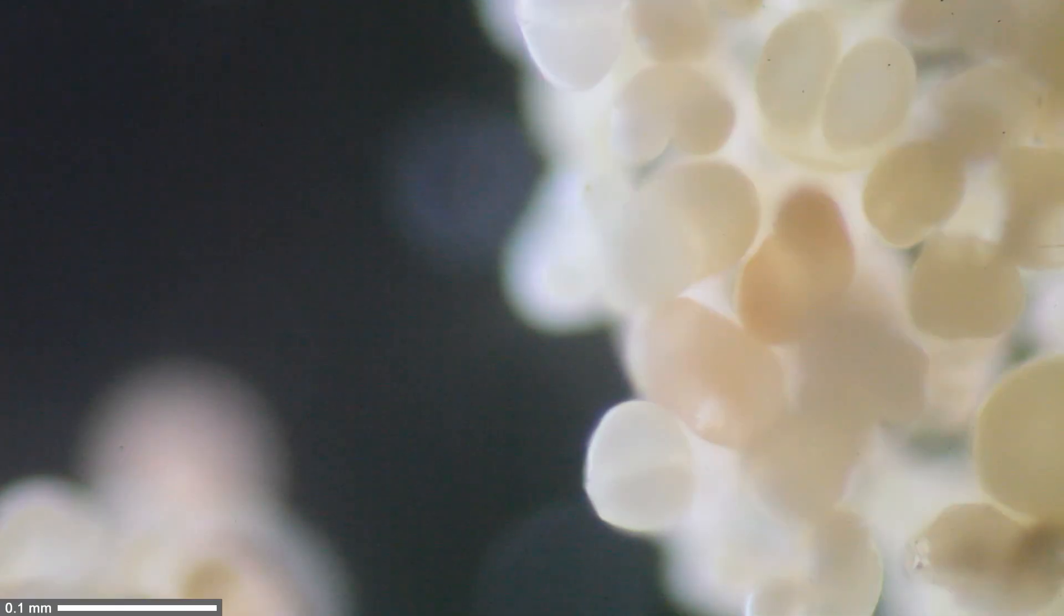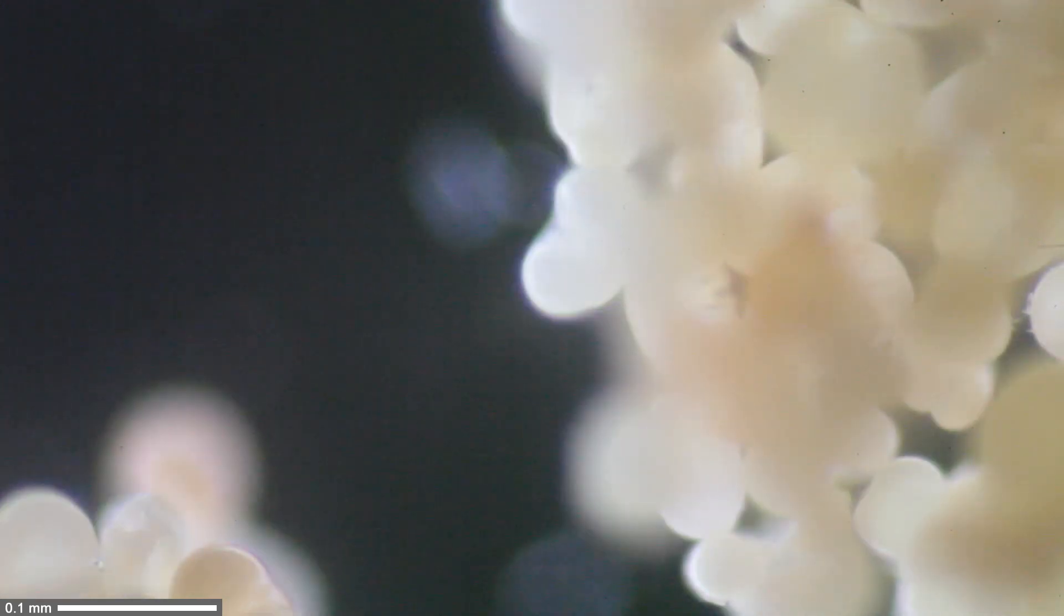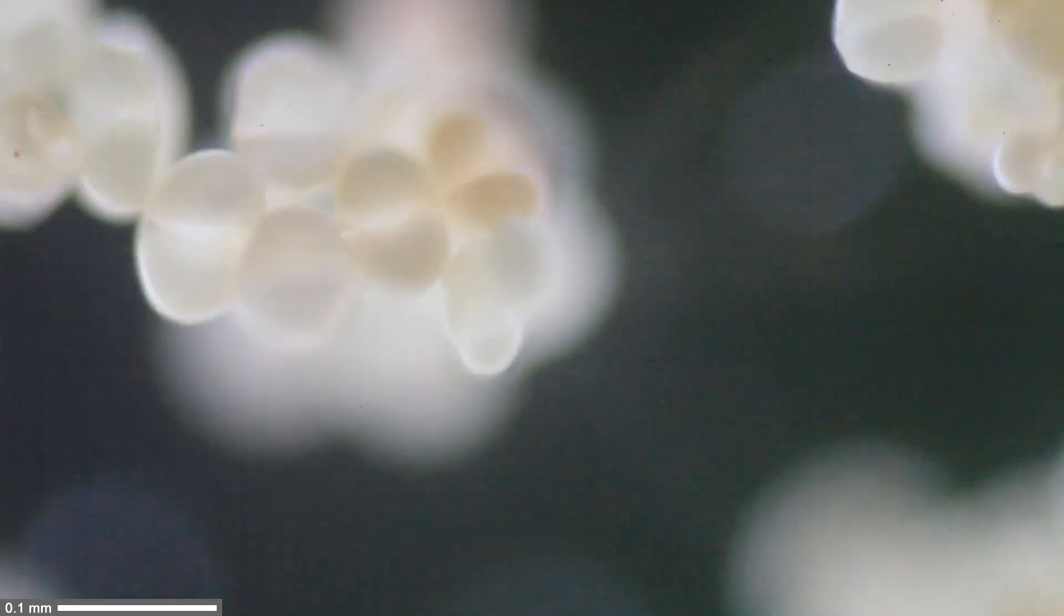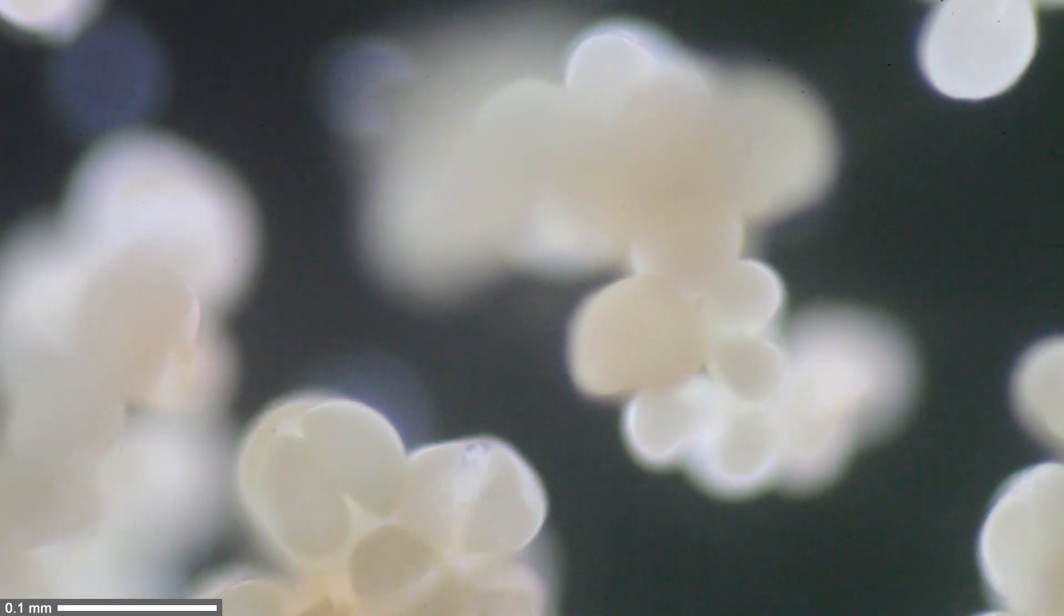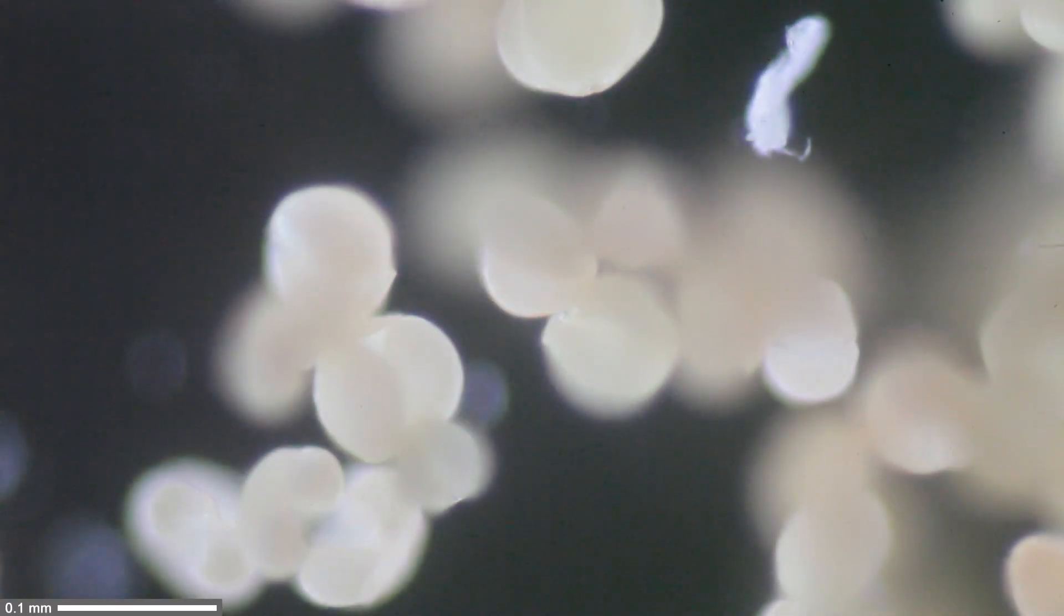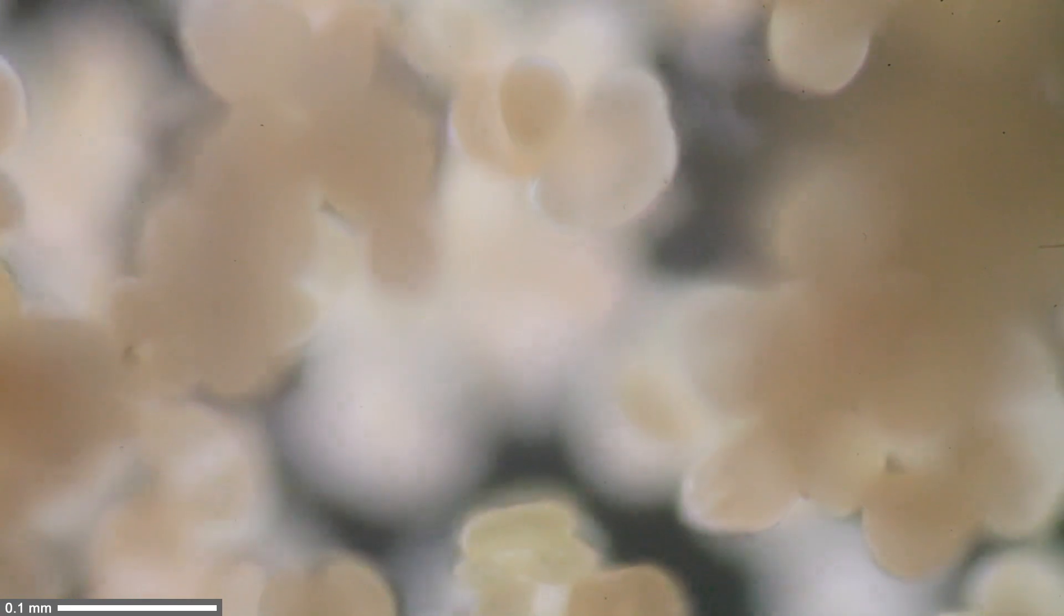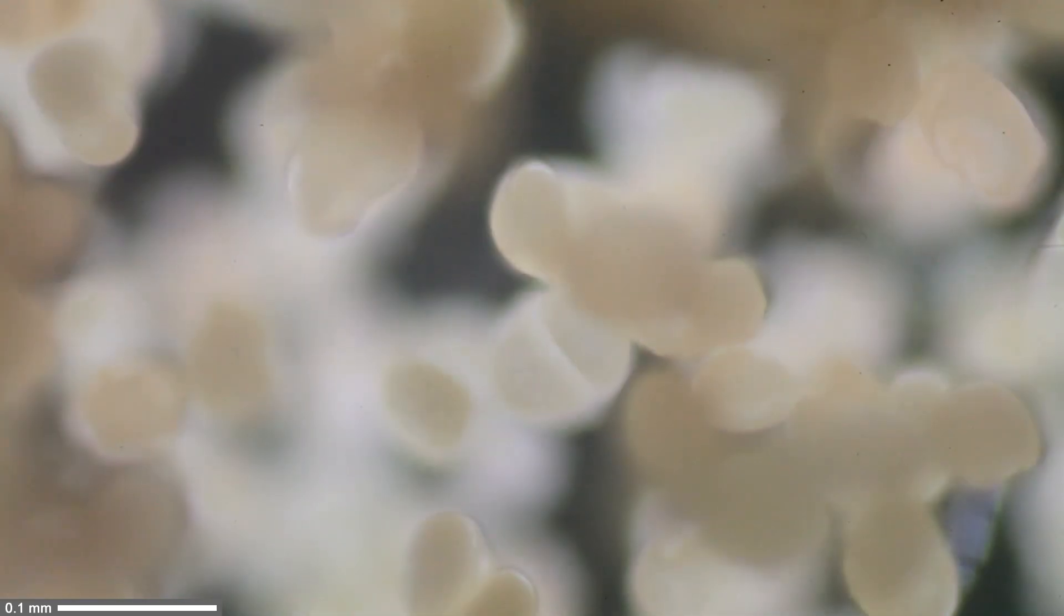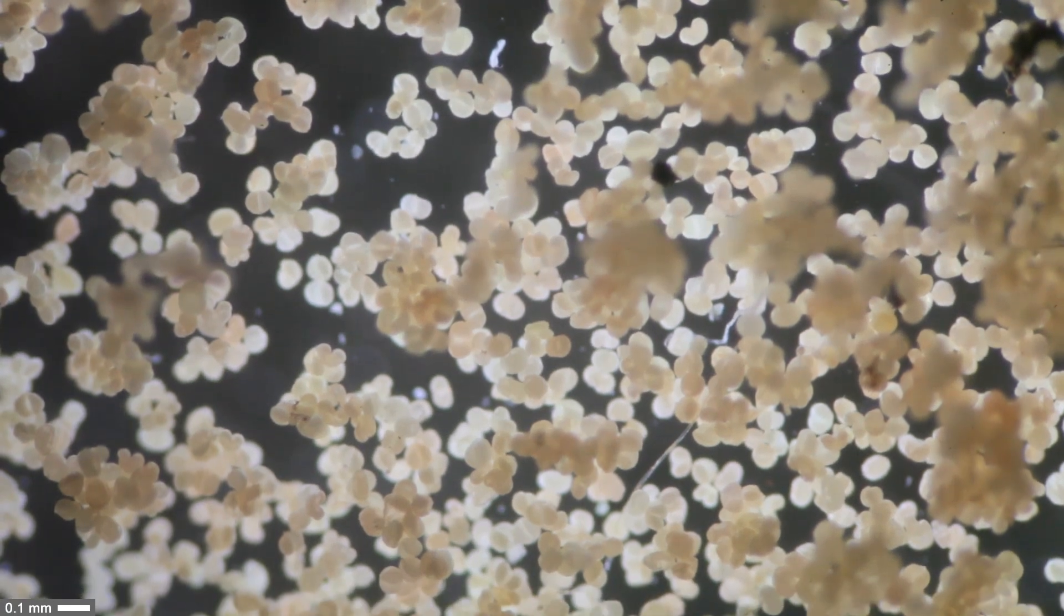At higher magnification in dark field using the 20x objective, the depth of field is now quite low, so I have to work constantly with the fine focus knob. Using a concave slide can be seen as an advantage or disadvantage because the pollen aren't flat - they're stacked on top of each other. The resolution is also low because I'm not using a mounting medium. Pollen are often mounted in dry mount because if I add water, the pores start to swell up.